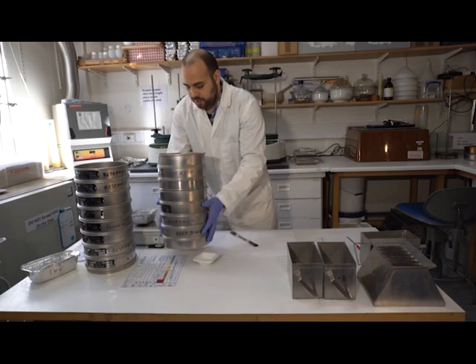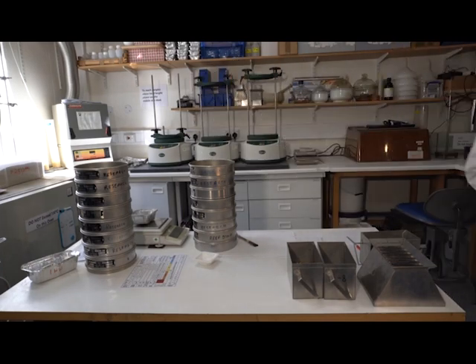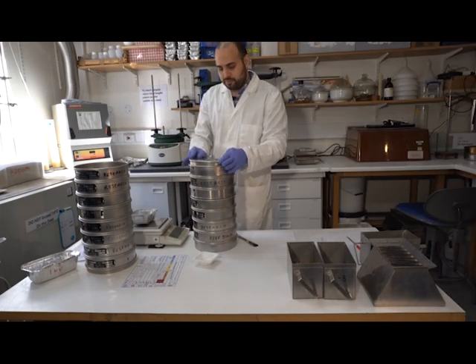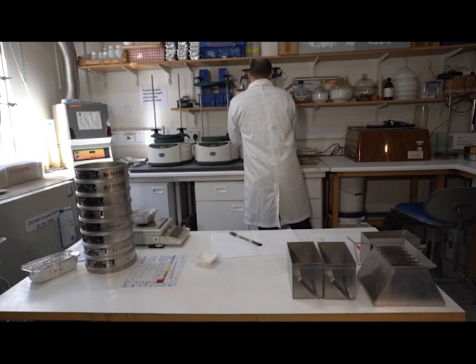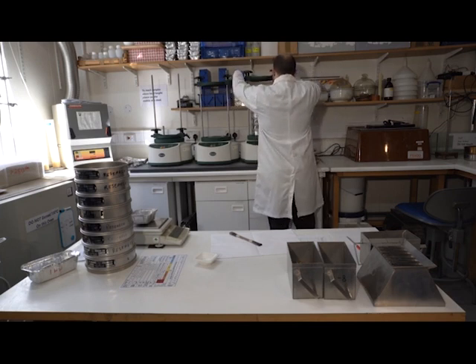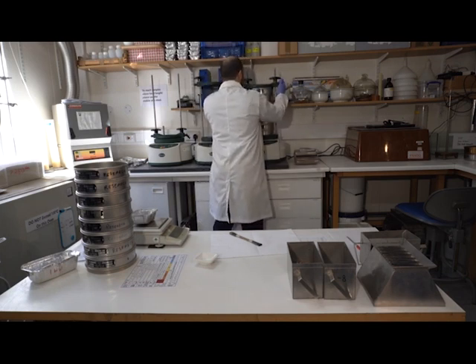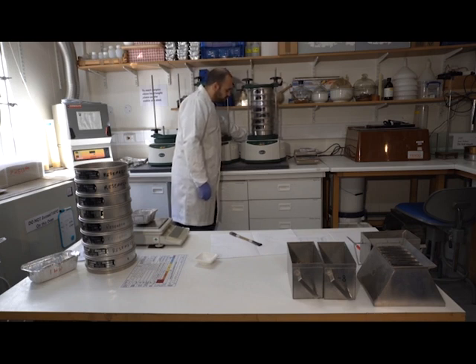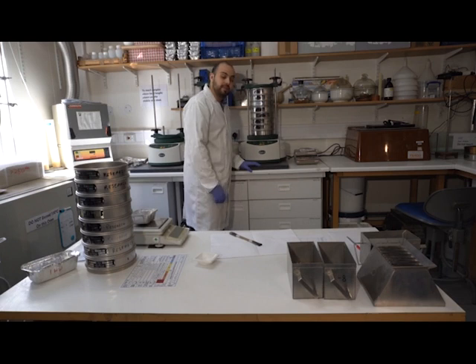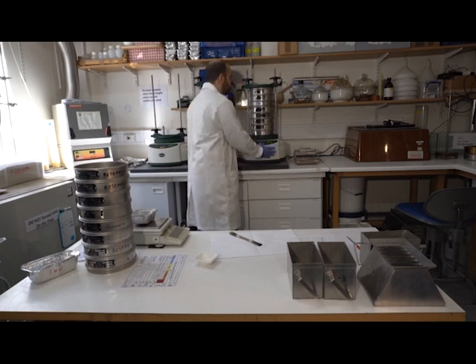Okay, now that's ready. To go on the sieve shaker, I need to put a cover plate at the top, so I need to get that. And that sits here. I'm going to put the rubber to minimize the noise. And then I'm going to clamp this so that it's secure and tight. Okay. And now it's programmed to run for 10 minutes at a relatively medium power range. And I will start it. It's going to be very noisy.